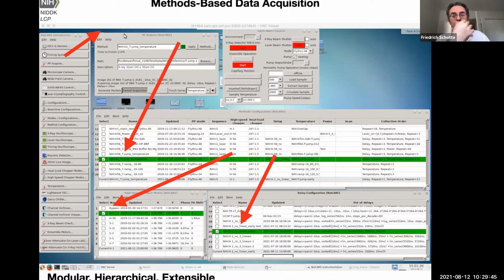So how to collect the data and where to save them, basically. There are a lot of parameters, of course, you can change in a data collection. So what type of time resolution do you need? What chopper modes are appropriate for that? What's the corresponding heat chopper setting that matches that? Which time delays do you want to collect, and so on.